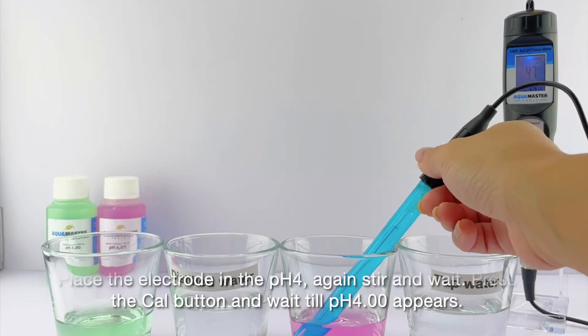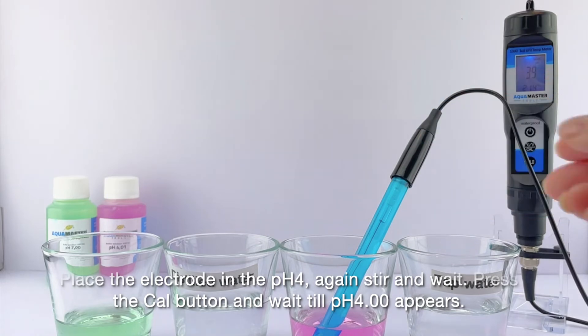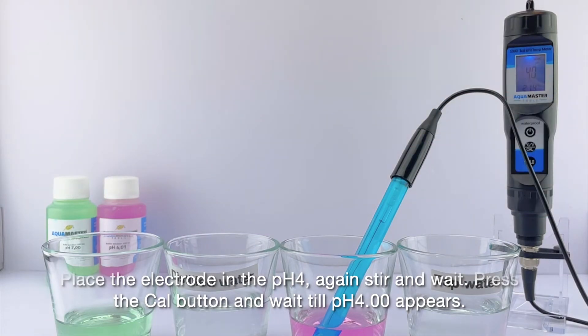Again stir and wait. Then press the calibration button and wait till the 4.00 appears.